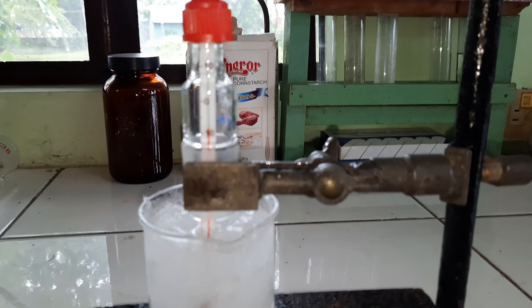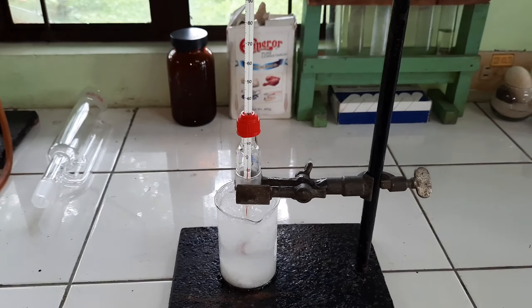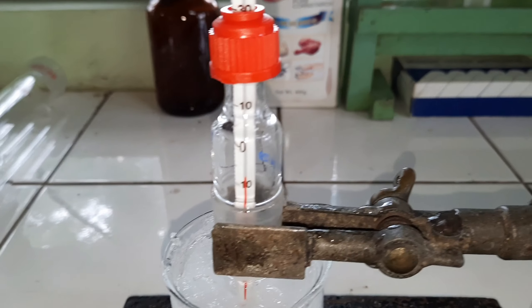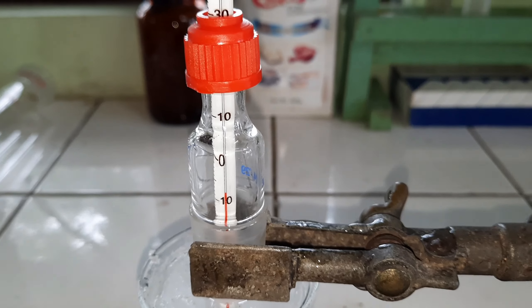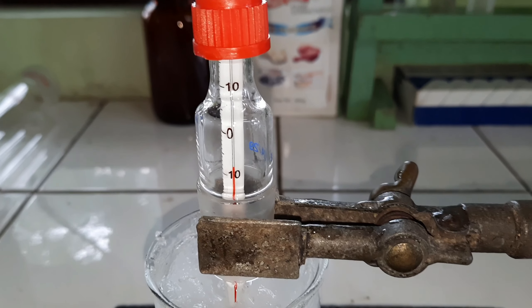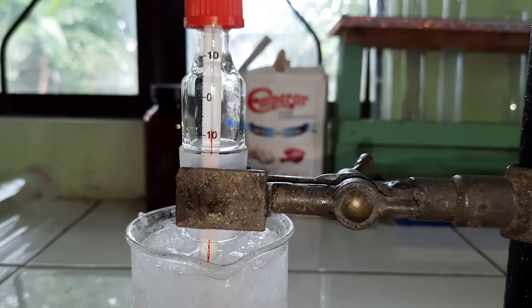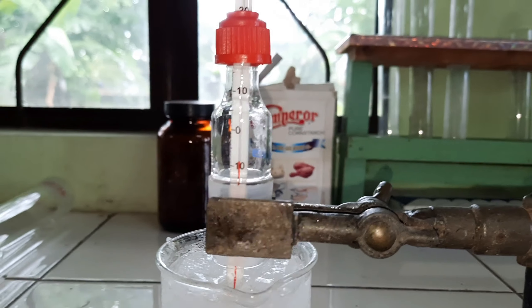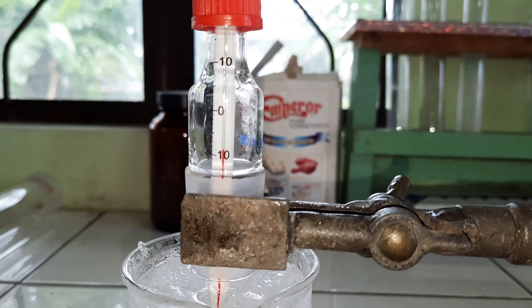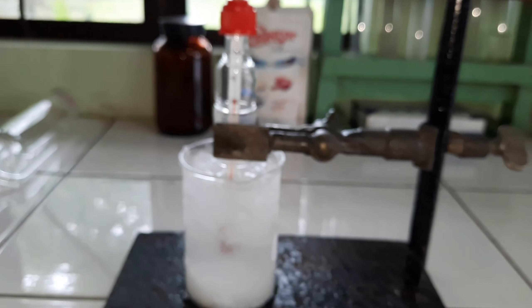We'll see if it will go down further. It's about negative 9 at this point. We will stop once we can no longer see further depression in the freezing point. We'll continue as long as the freezing point drops.